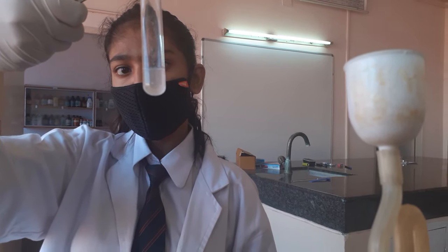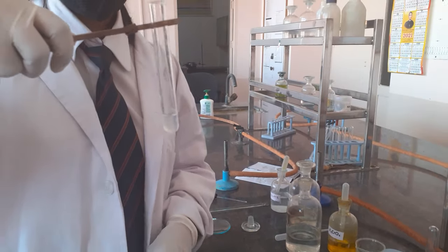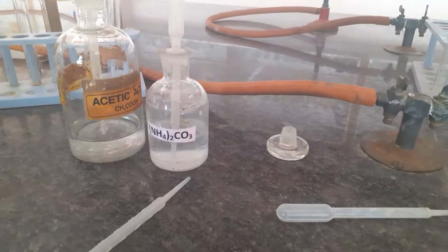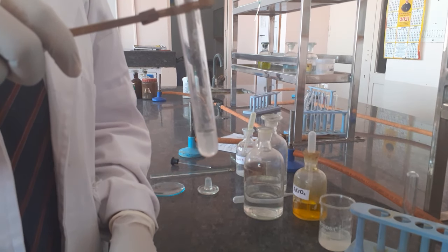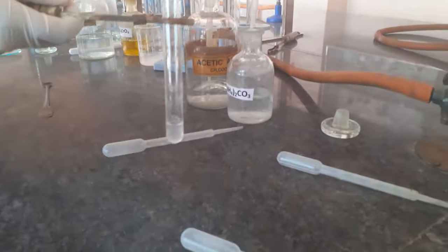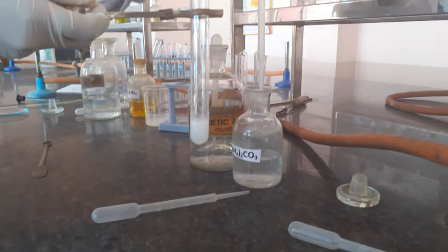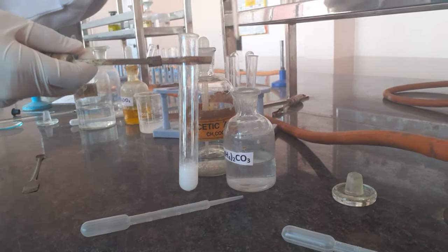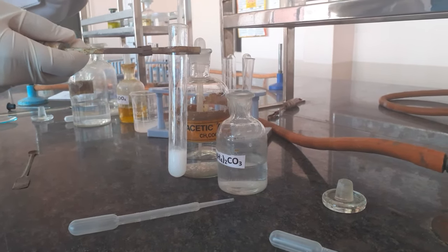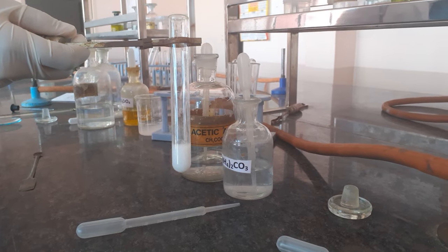Now take the second part kept for group 5. Add ammonium carbonate solution dropwise — this is the group reagent for group 5, used after already having added ammonium chloride and ammonium hydroxide. A white precipitate forms, indicating the presence of group 5, which means the salt contains either barium ions, strontium ions, or calcium ions.